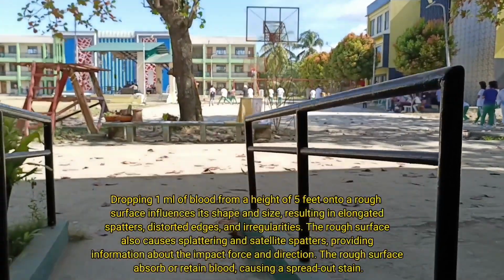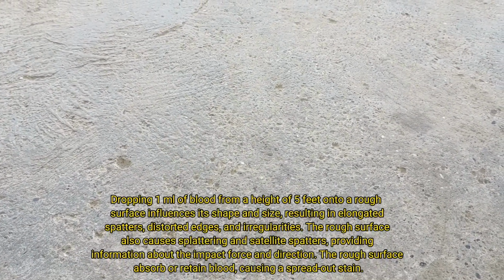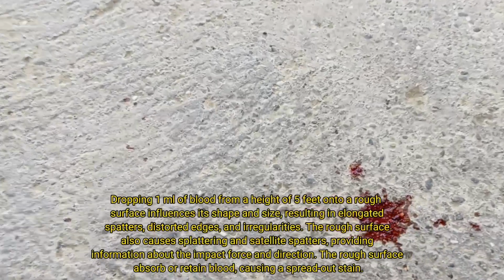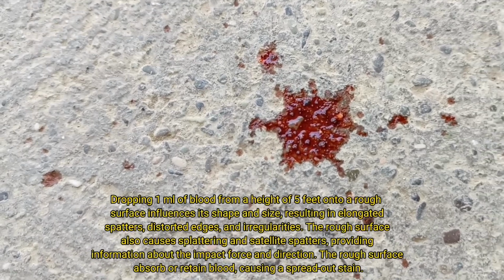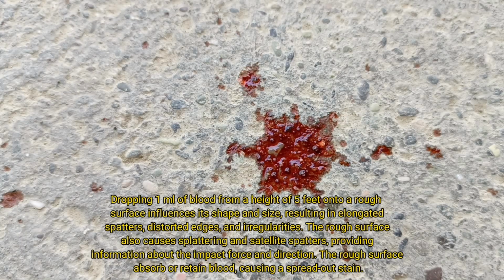Dropping 1 milliliter of blood from a height of 5 feet onto a rough surface influences its shape and size, resulting in elongated spatters, distorted edges, and irregularities. The rough surface also causes splattering and satellite spatters, providing information about the impact force and direction. The rough surface absorbs or retains blood, causing a spread-out stain.